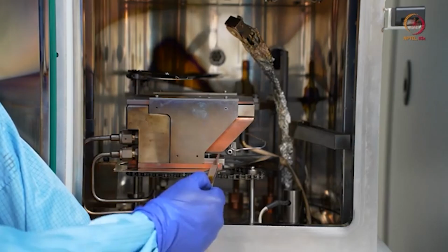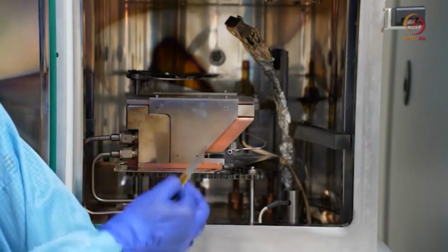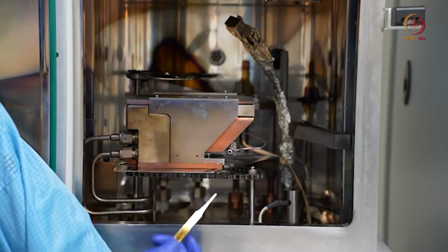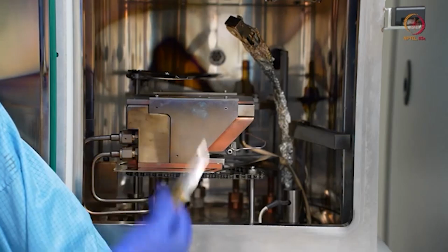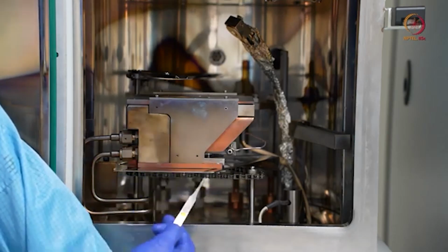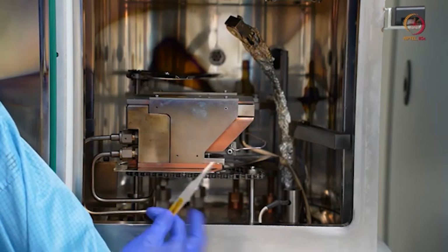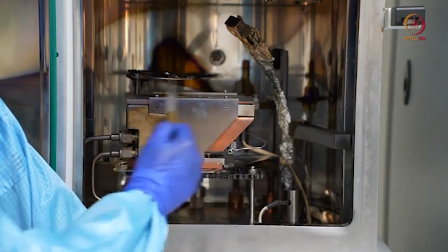Otherwise, this is a filament made up of tungsten. The tungsten filament will be very hot and you should not open the chamber and let a hot filament be exposed to the air. There is a fair chance that it will be oxidized or it will go bad. So this is mainly about this module.